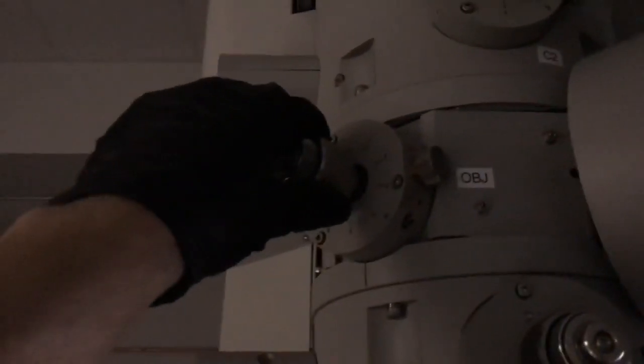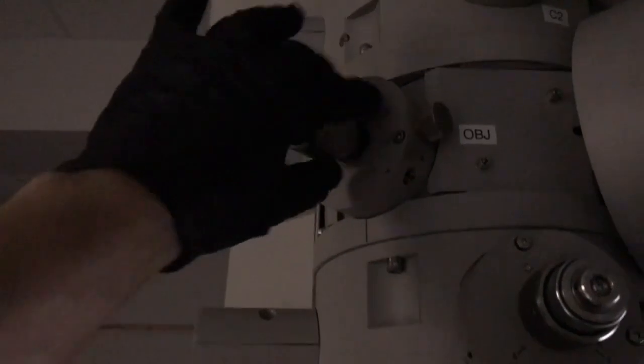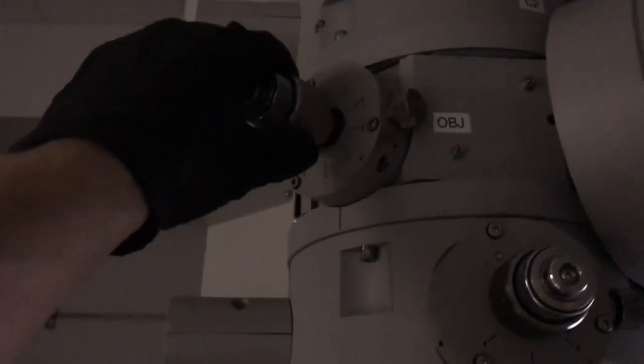Okay, so I think I covered this in the general operation video, I'm not sure, but the way you have to do this is you take your objective aperture here, it doesn't matter which one, but I like to use a larger one for this because it's going to be easier to see it. So I'm going to put in, we'll go to position 2, and I can't really see the aperture here, it needs to be shifted a little bit. Okay, so there it is. Now I can see the aperture rim there.